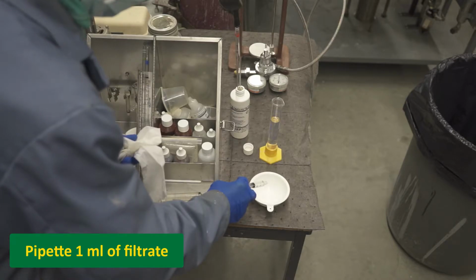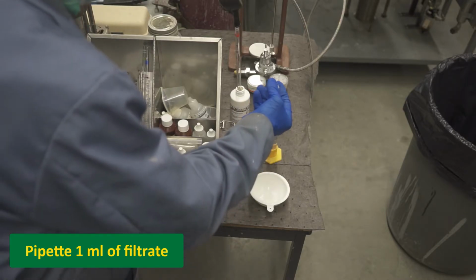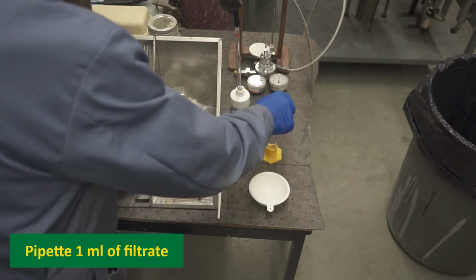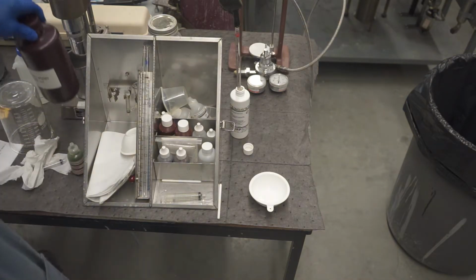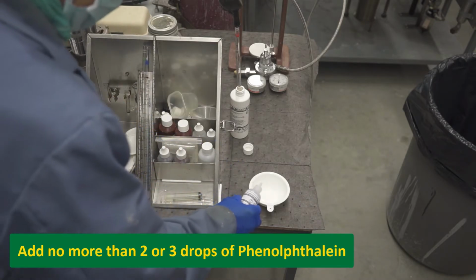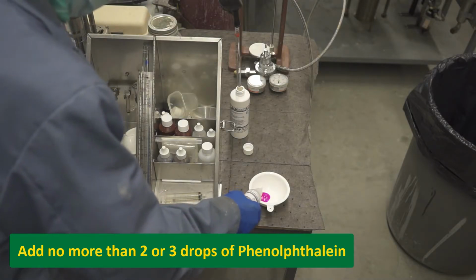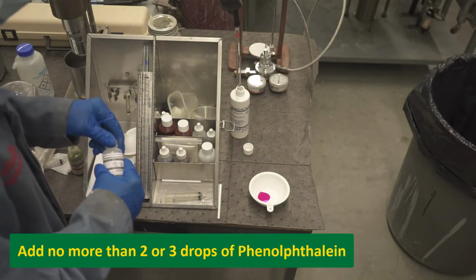Next will be the tests to find PF and MF, starting with PF. To begin, pipette 1 milliliter of filtrate into a clean titration dish. Do not dilute with distilled water. Add no more than 2 or 3 drops of phenolphthalein. If no color develops, PF is 0 and pH is less than 8.3.